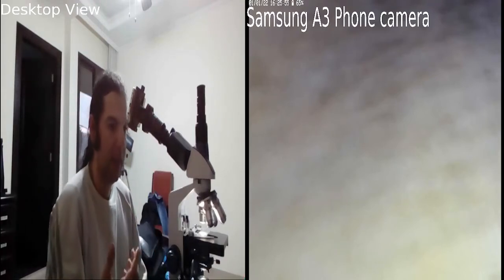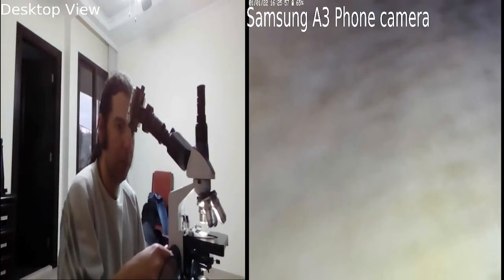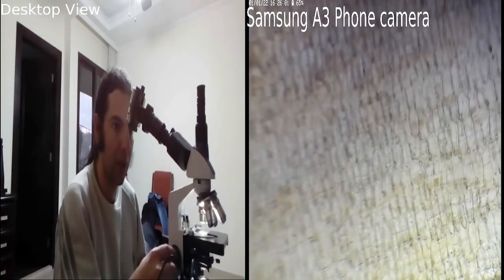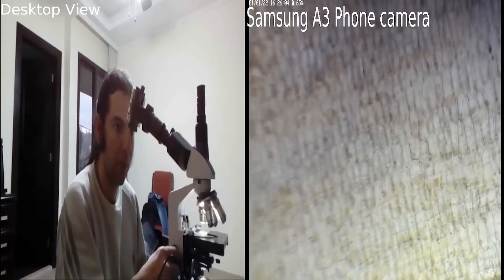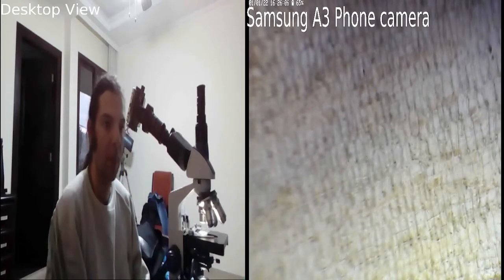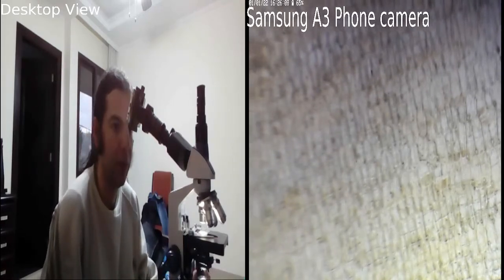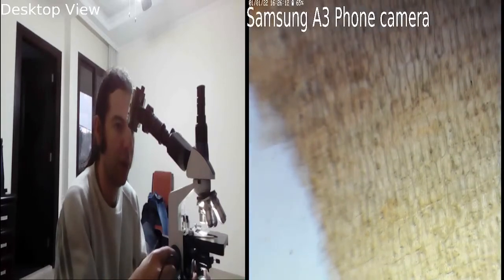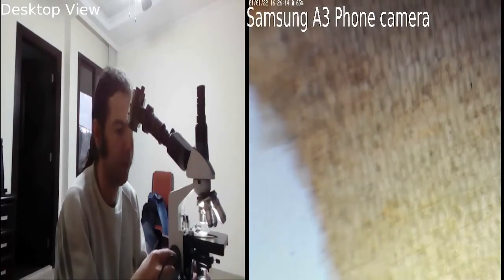Now that I change the focus, yes, this is the onion. And voila, we are doing microscopy. Microscopy, not telescopy. This is microscopy.